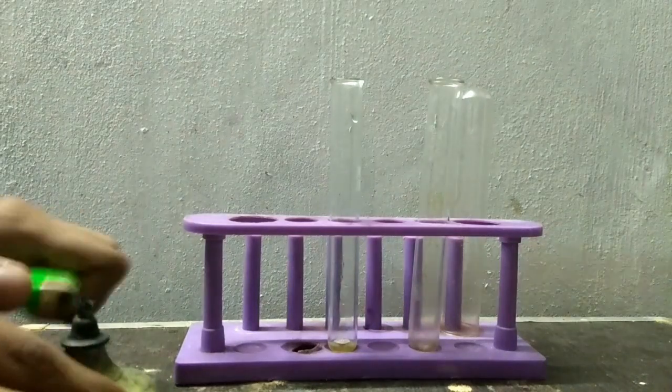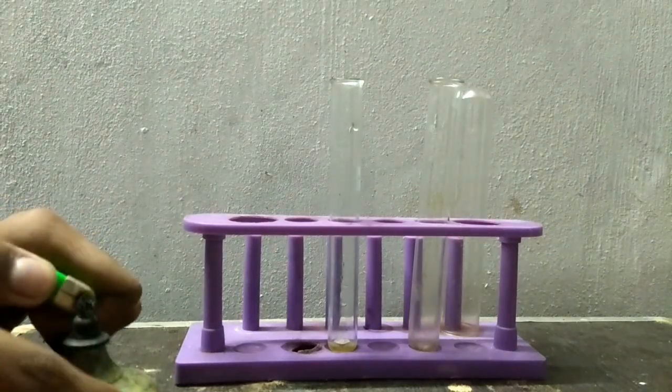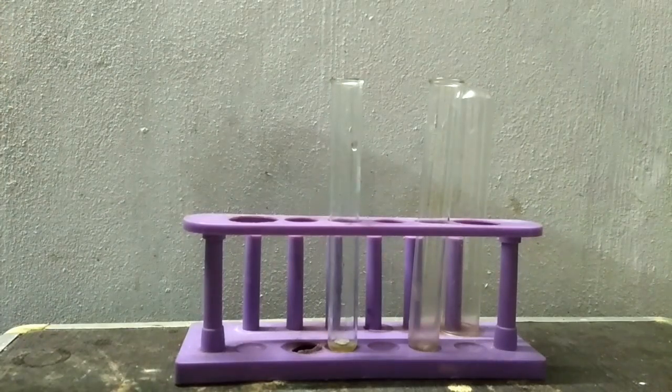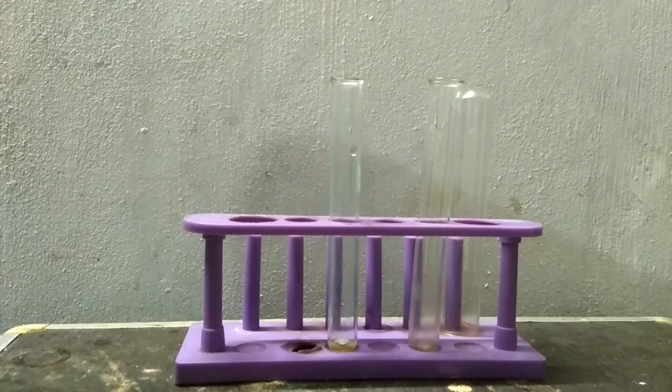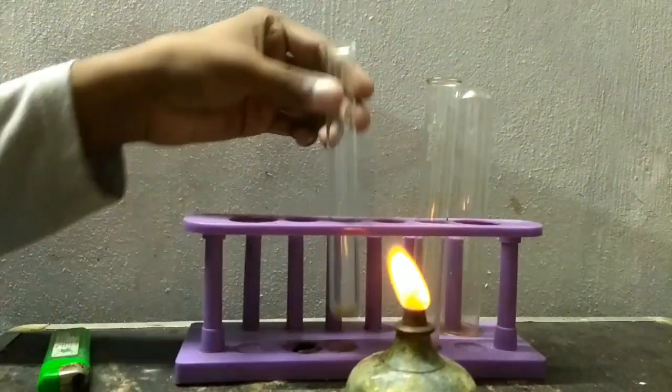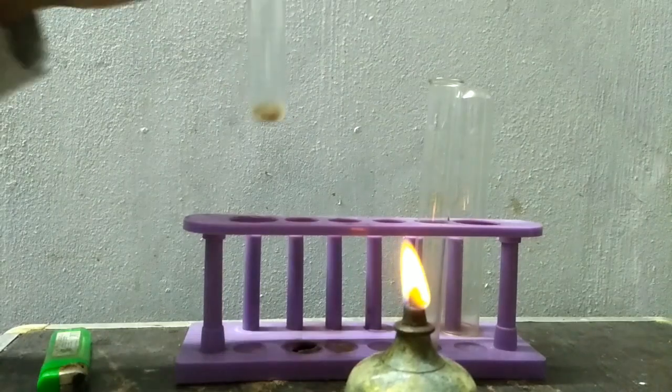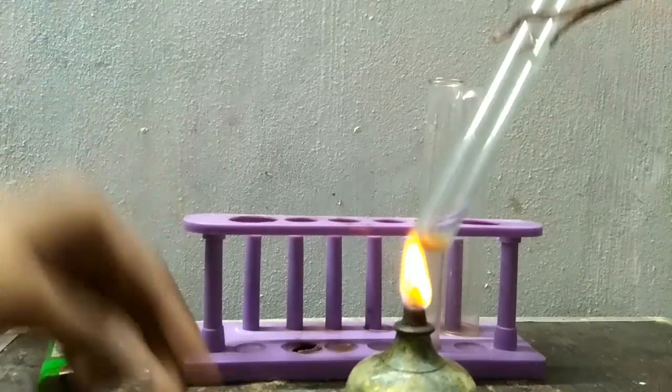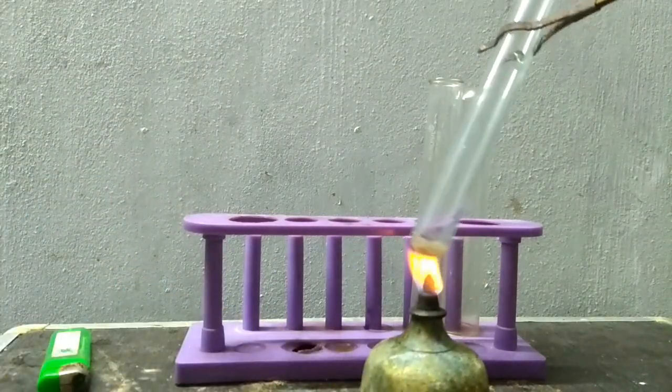Now we will add a few drops of concentrated sulfuric acid and heat it.